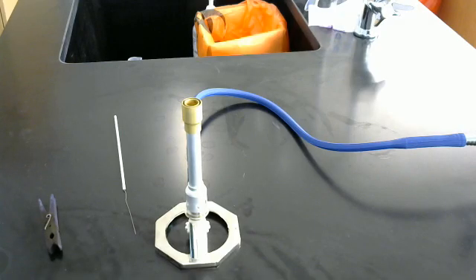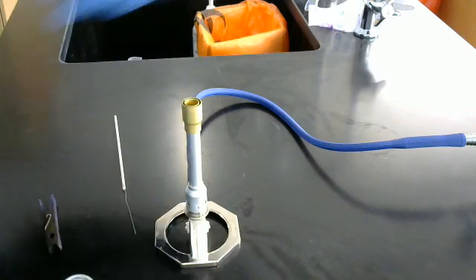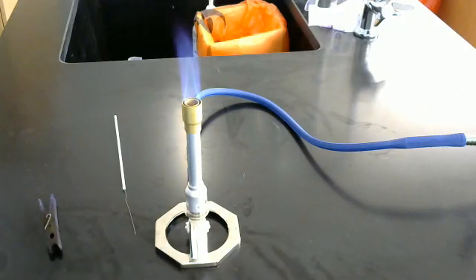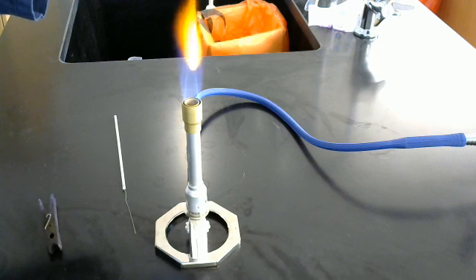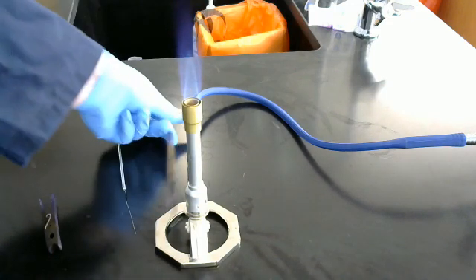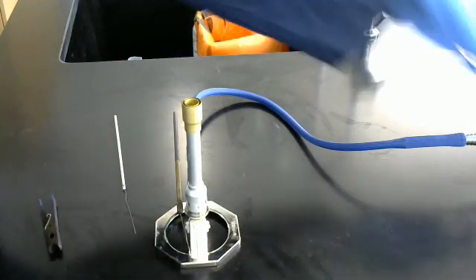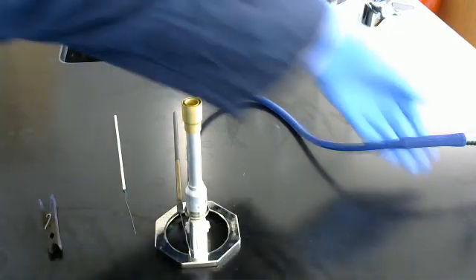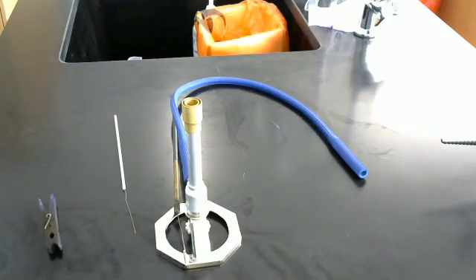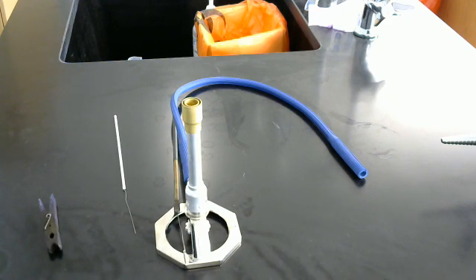Now that's a lot of bacteria, that's not going to be a very good Smear Prep, because there's a lot of bacteria there. We do want to have the aseptic technique and we do want to prevent any type of contamination onto our slide.